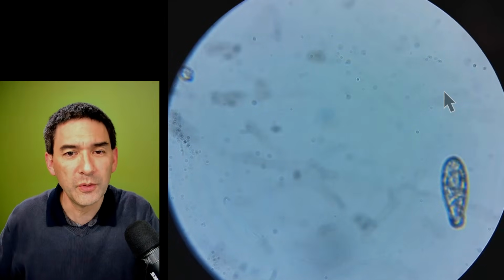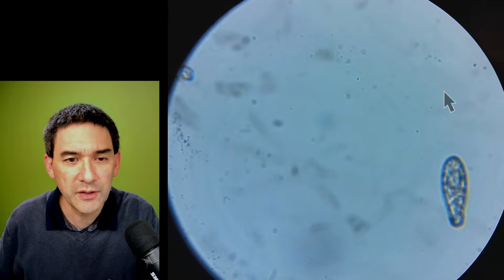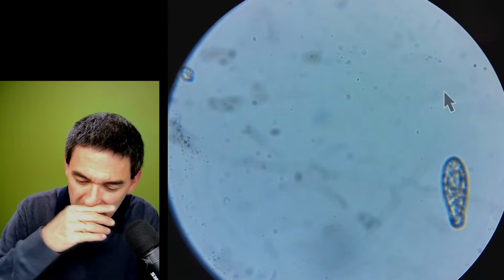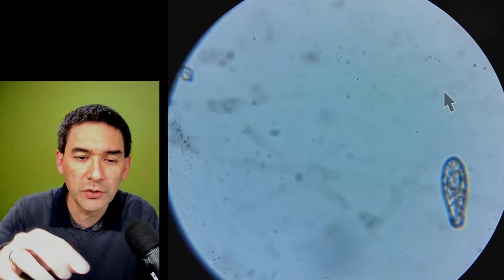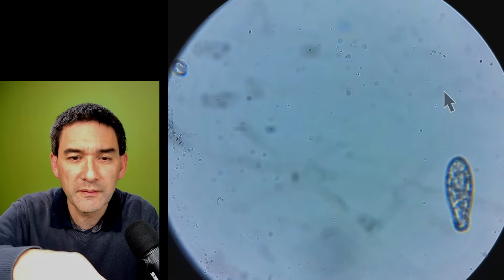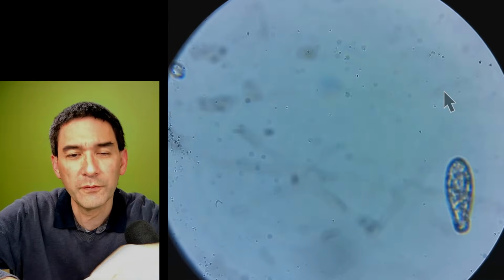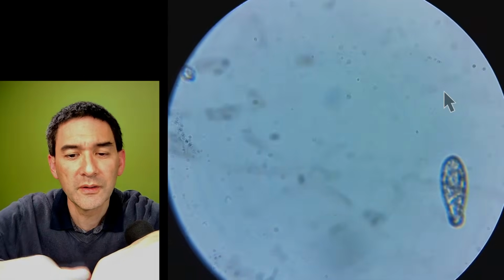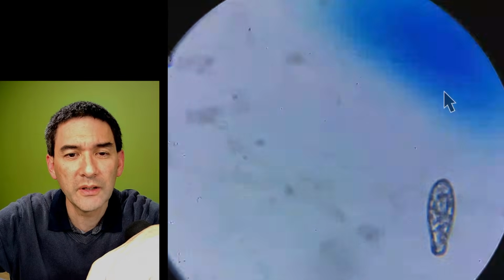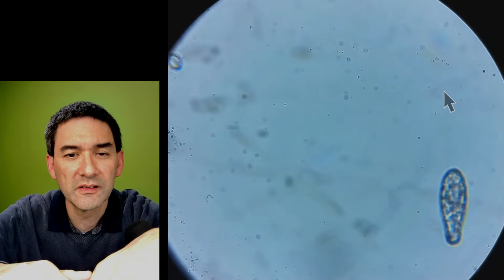Just to locate the dirt, what you do is you have to turn the whole thing. Yeah, and I'm turning it now, so you see that everything that also turns must be either in the optics or somewhere in the light path. And if it does not turn, then it most likely is somewhere on. Let me do it like this. Let me try to do the following. I will not turn it. Yeah. It's on the lens. Yeah, it's on the lens.